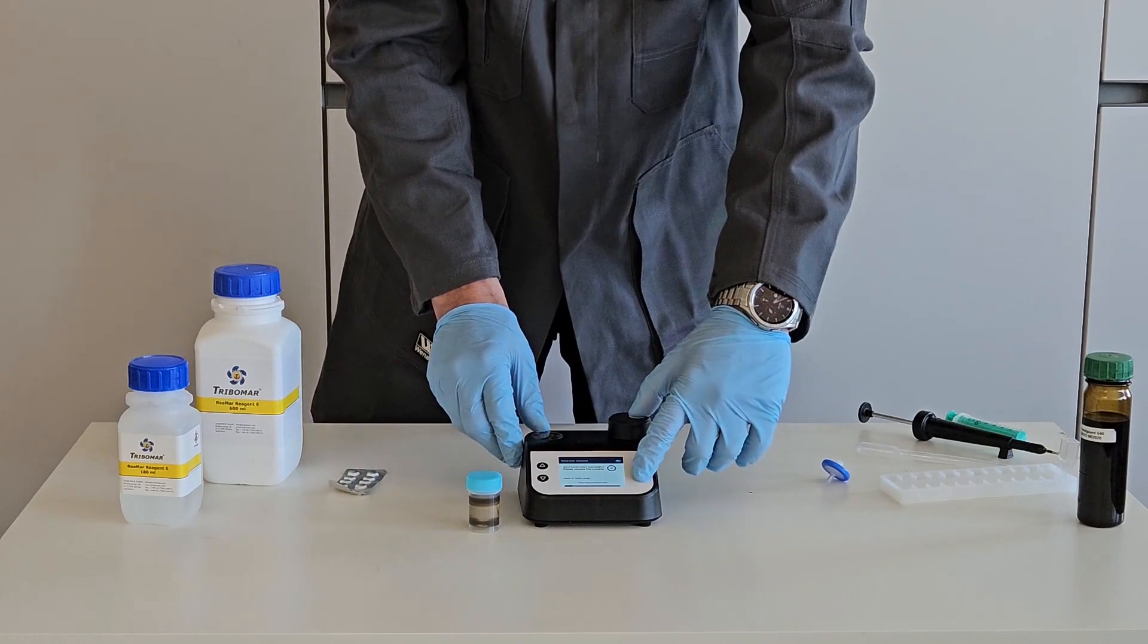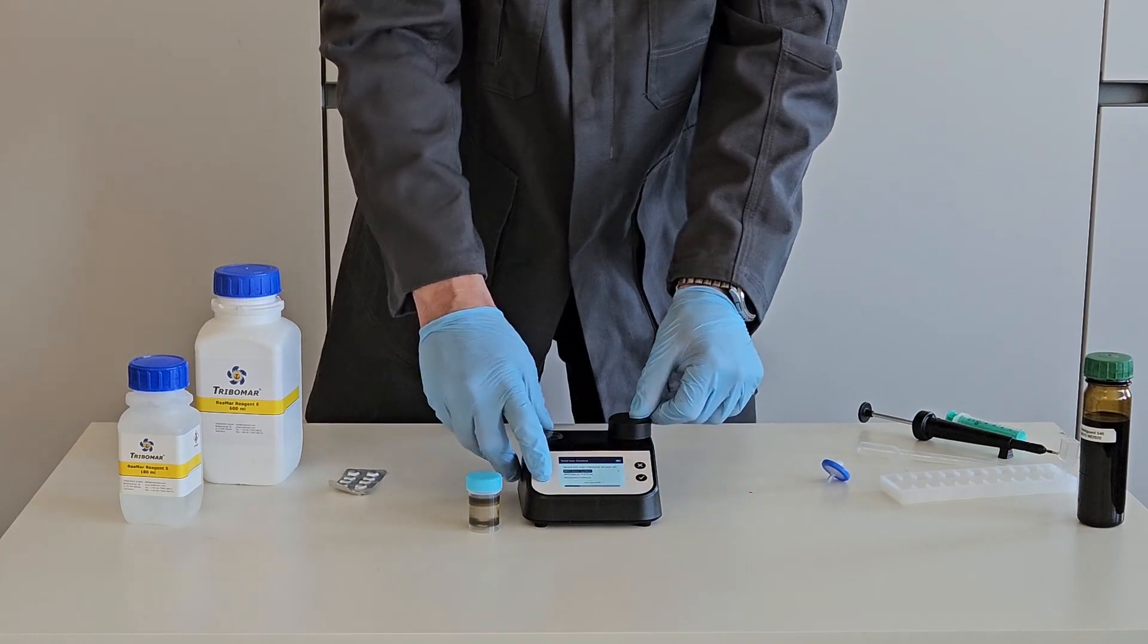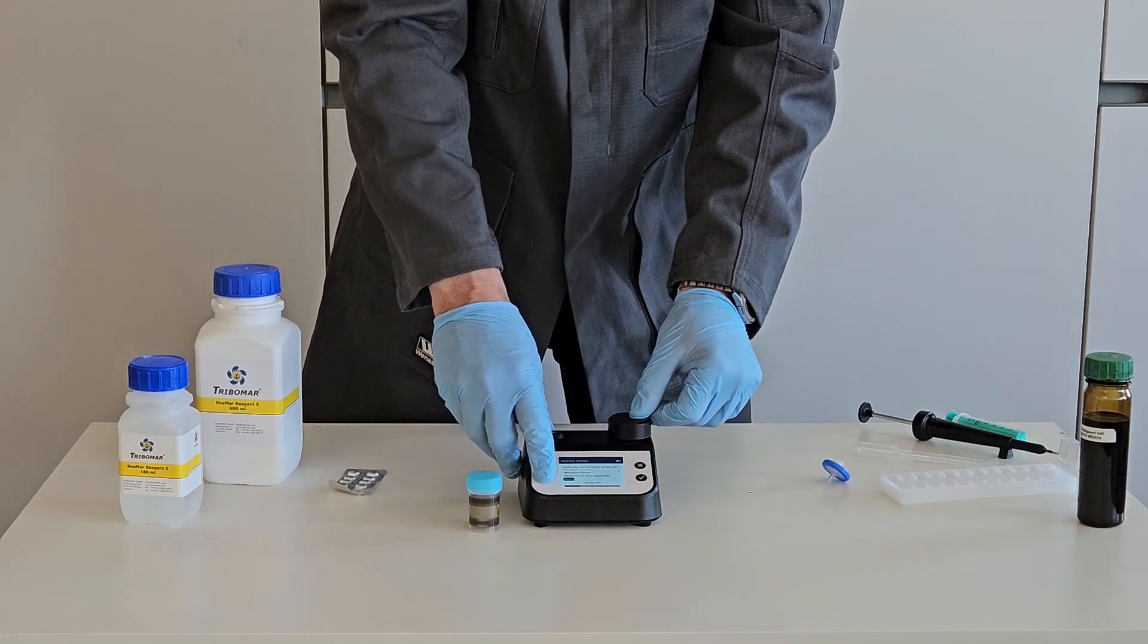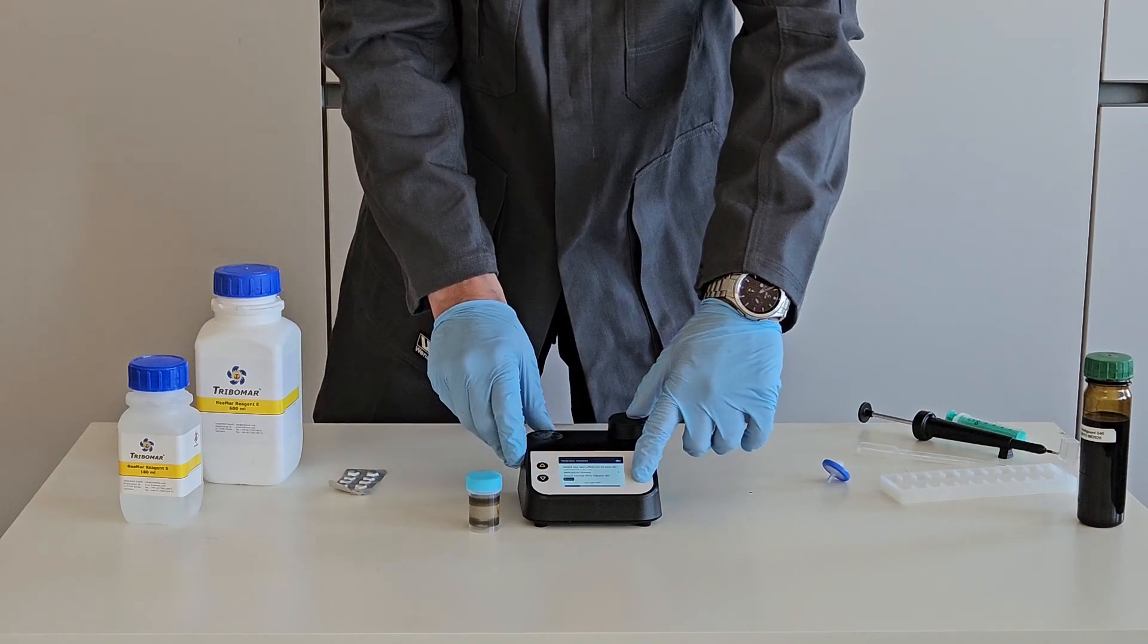Press OK and calibration confirms. Now press OK to choose your used oil brand. Press OK again.